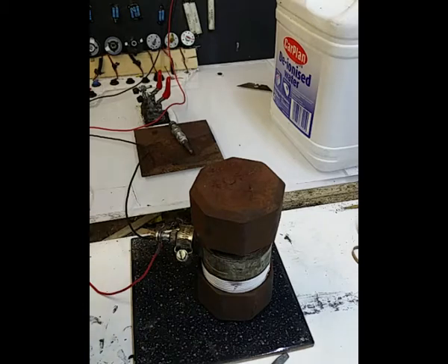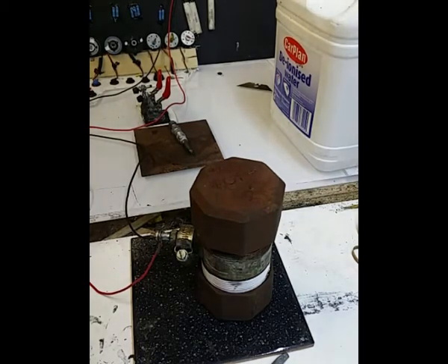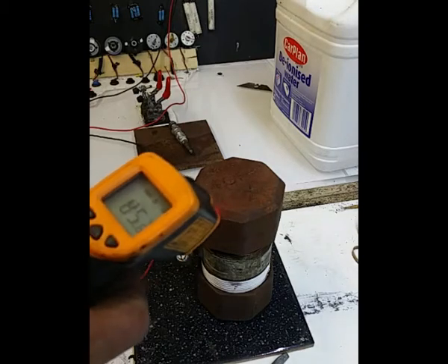Now if I just leave that for 5 minutes, it's only been on for a couple of minutes, give it 5 minutes and we'll see where we go with it. Obviously what I've got to do is just do it in increments and see what the temperature ranges are. So if I leave that now at 6.3 volts and 5.8 amps, whatever it settles at, and measure the temperature, that's the temperature for that voltage, because the current does waver a bit, and then up it by a volt or 2 volts or whatever to get the temperature that you actually require. So here we go again.